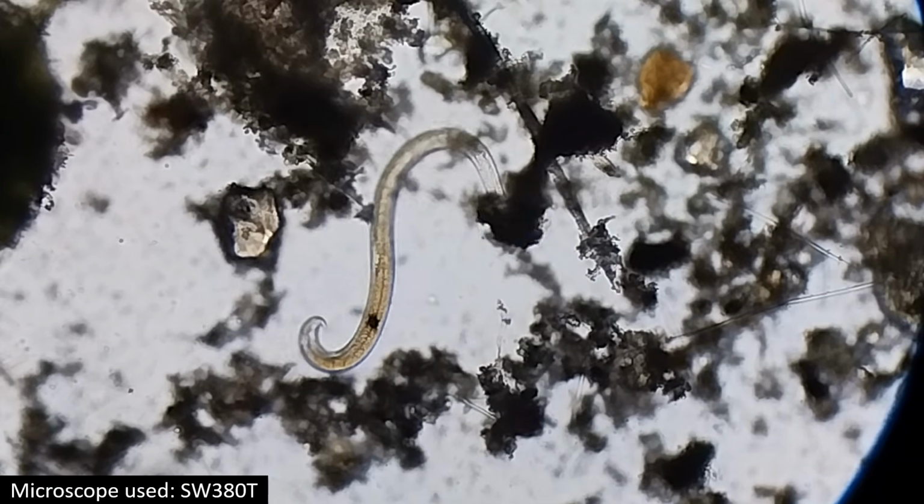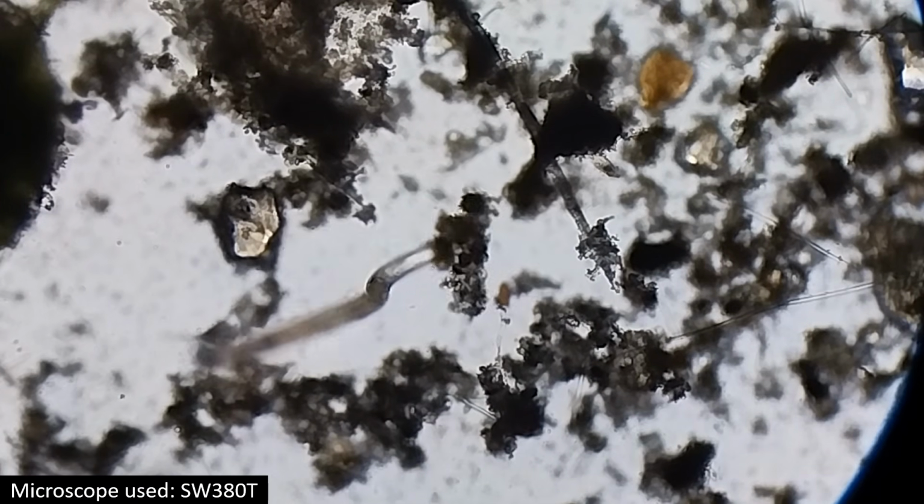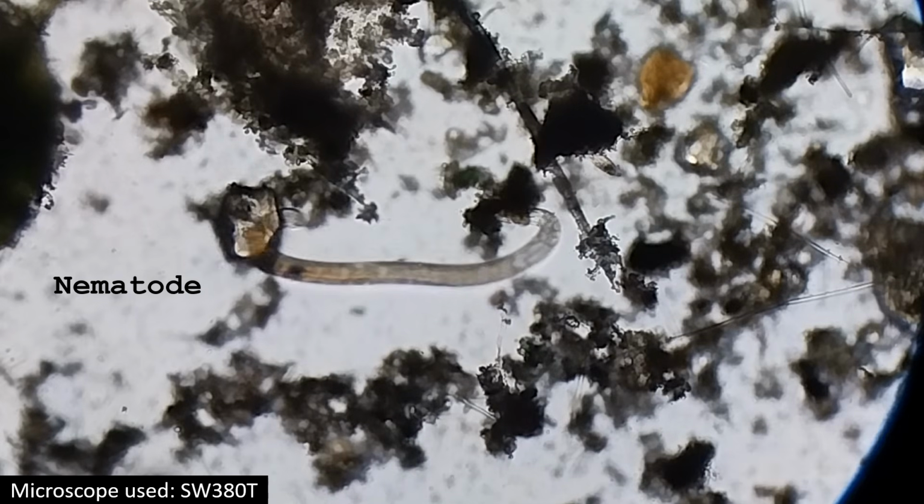And that's the end of our video. Until the end of this video, I'll be showing clips of microorganisms found in these samples.